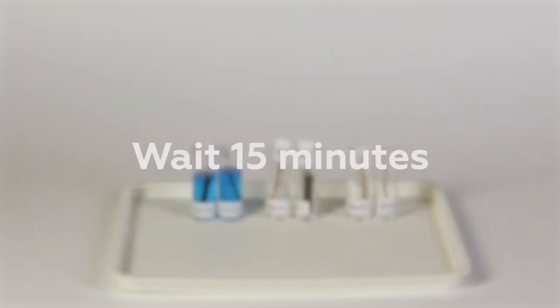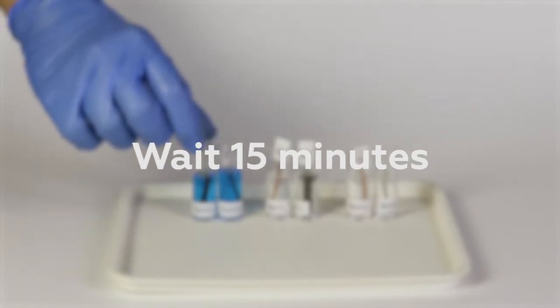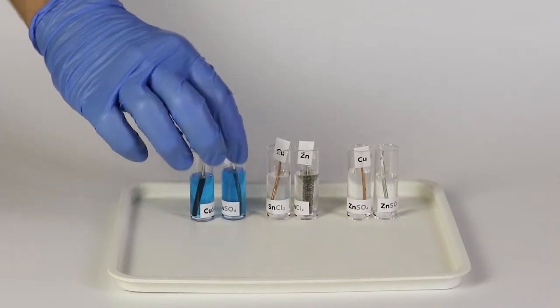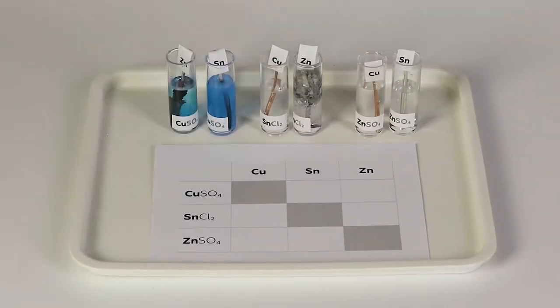Now wait for approximately 15 minutes. Record your observations in the table of results.